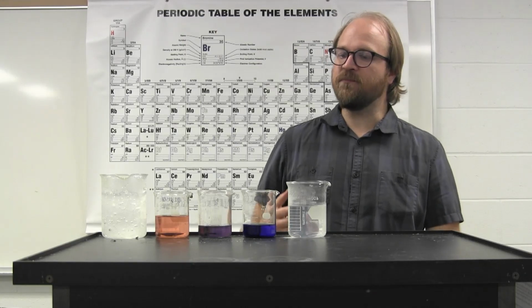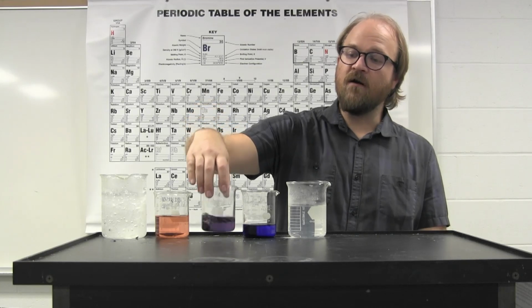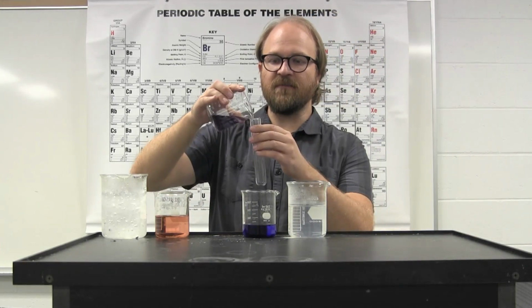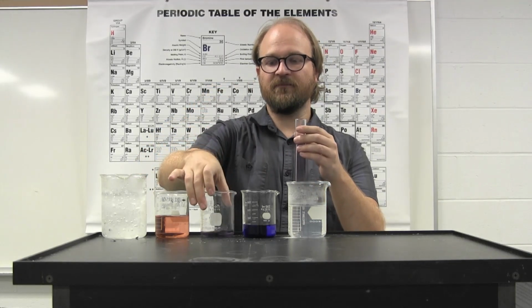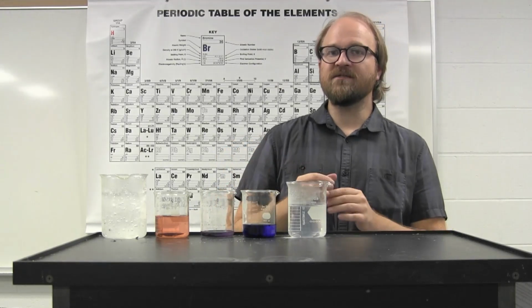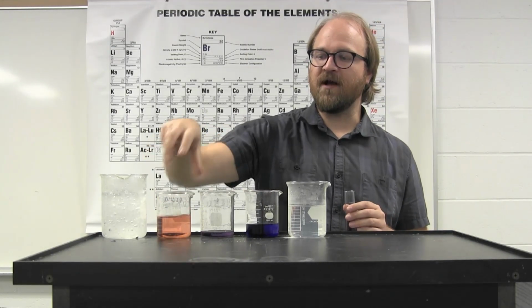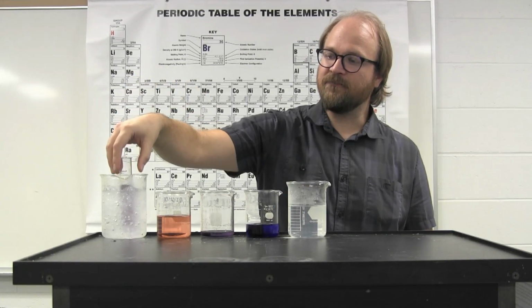With the cobalt solution prepared and properly mixed to achieve a blend of both complexes in equilibrium, you can move on to the last part of the experiment, which is the temperature dependence of the reaction. The blend is a purple color, a mixture of the blue tetrachloride complex and the red hexaquo complex. The reaction itself is temperature dependent.